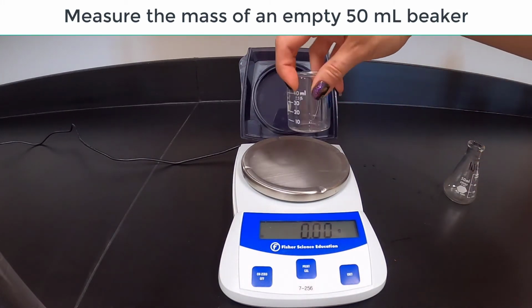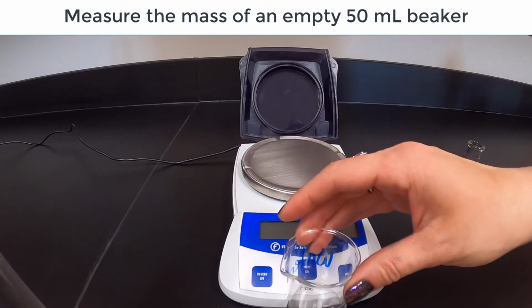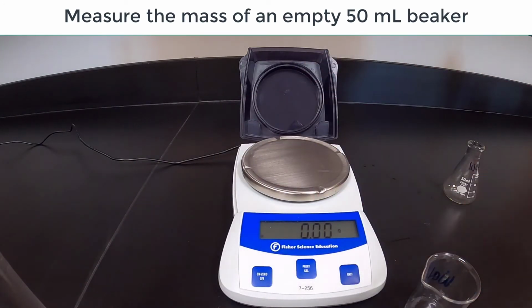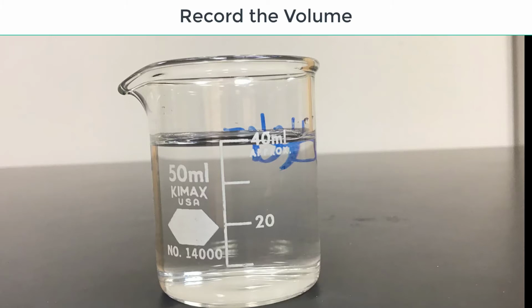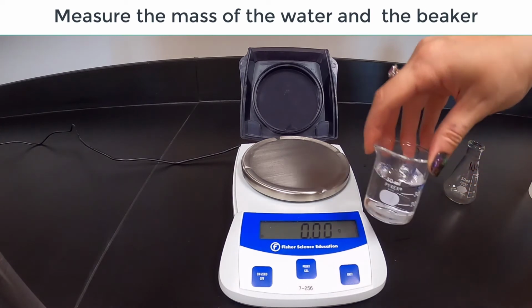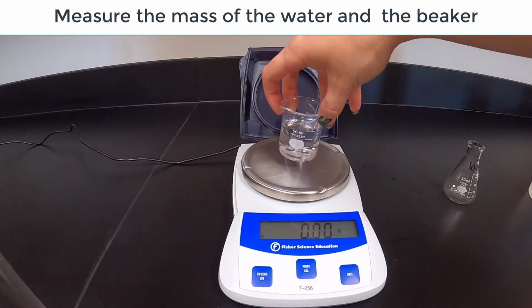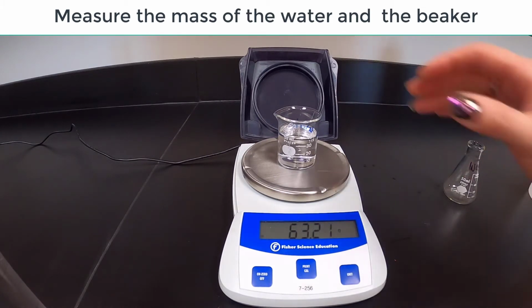Record the mass of a 50 ml beaker. Measure 40 ml of distilled water into the beaker. Record the volume. Reweigh the beaker with the water. Record the mass. Calculate the mass of the water.